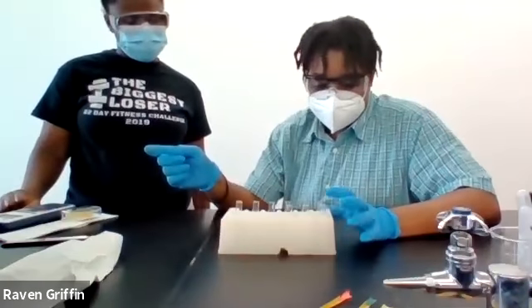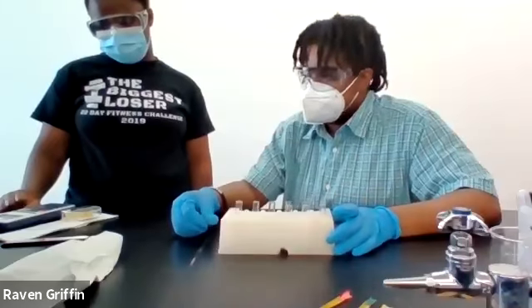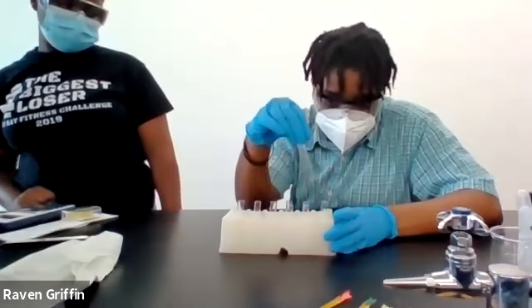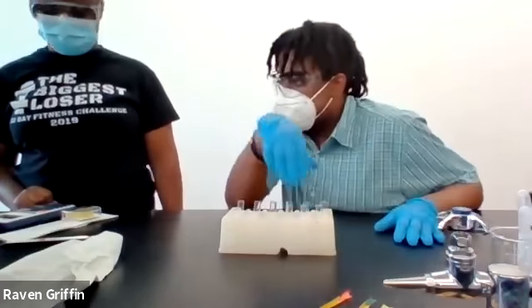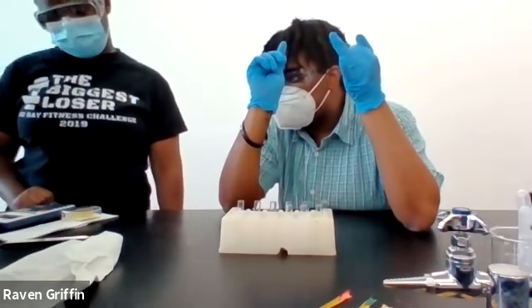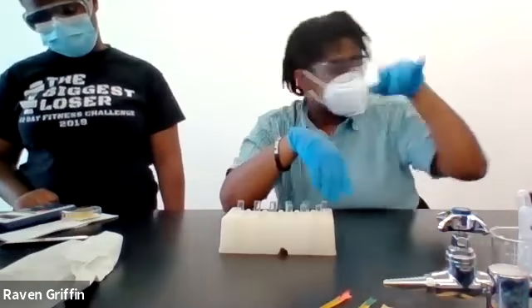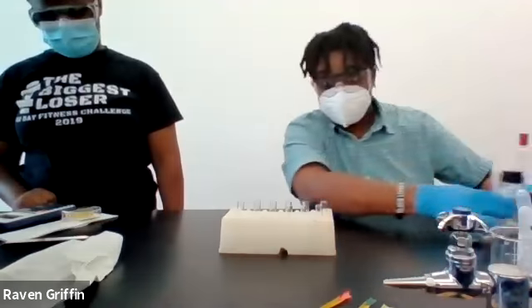So this one, part D2, is about reacting zinc with different acids of different concentrations. So all 9 of these test tubes have a little bit of zinc metal in them, and we're going to add phosphoric acid, hydrochloric acid, and sulfuric acid, all at 3 different concentrations. So I'm going to start with the phosphoric.